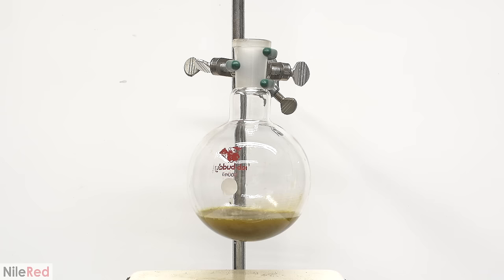The beaker is then placed in a fridge for a few days to allow the piperine to fully precipitate. In the meantime, I start to clean things up and I empty out all of the pepper from my Soxhlet extractor. It's still wet with isopropyl alcohol, but I'm going to wait a few days for it to fully dry out.